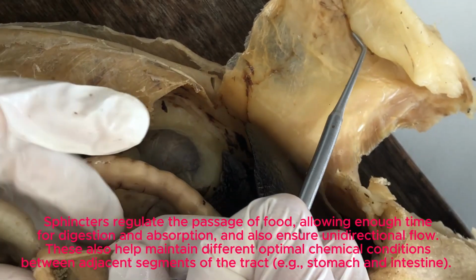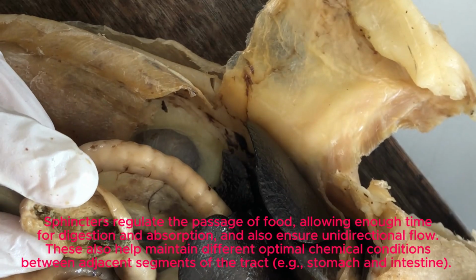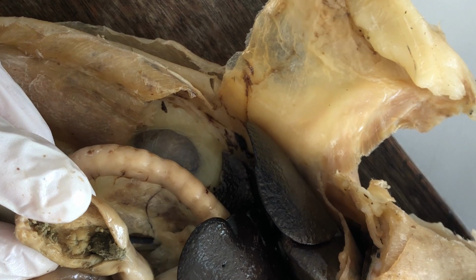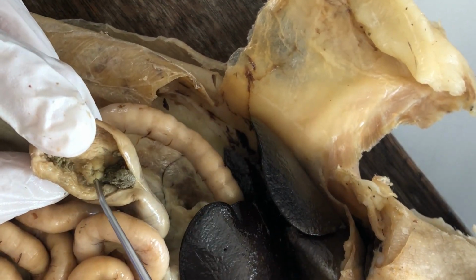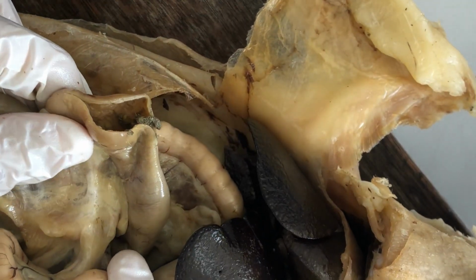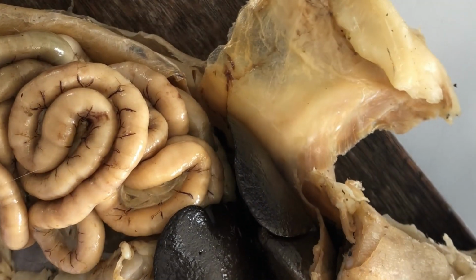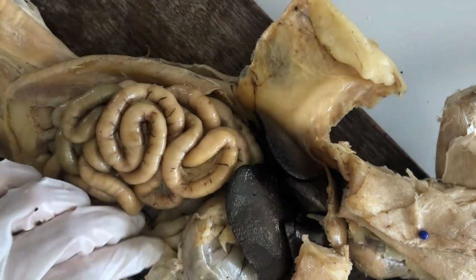So that's the generic function of valves. They control the flow of substances. It's not just continuous. You have to stop first for complete digestion and then move on to the next segment. So this, the ileocolic valve regulates the passage of digested food from the small intestine into the large intestine. And that's basically the digestive system contained inside the abdominal cavity. But that's not everything actually.